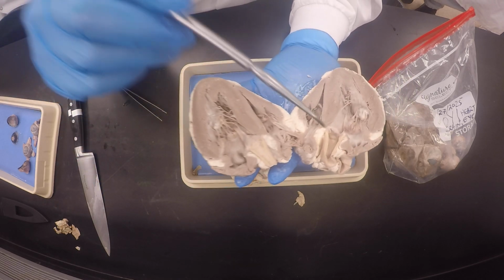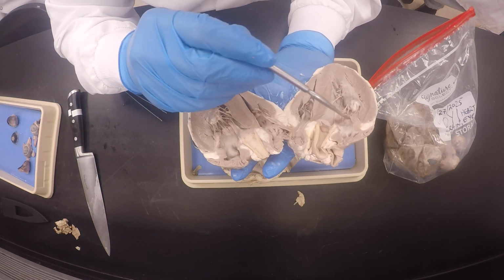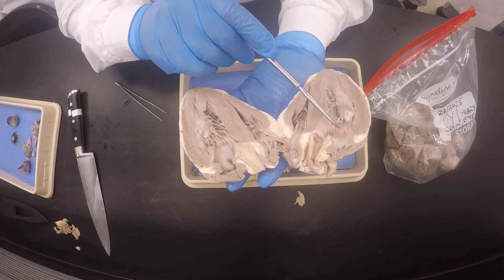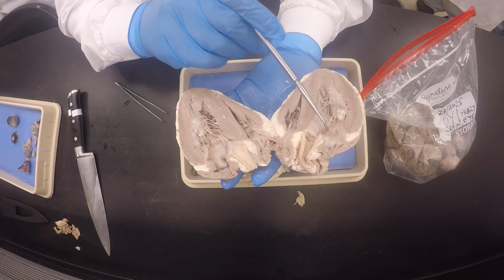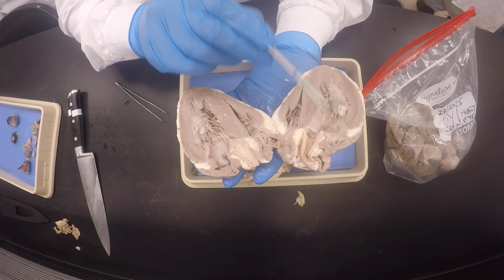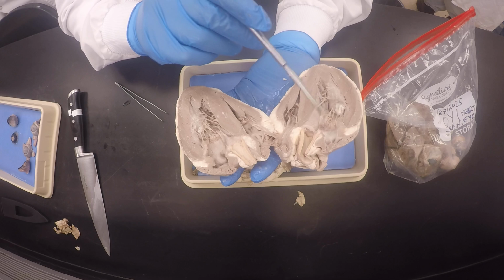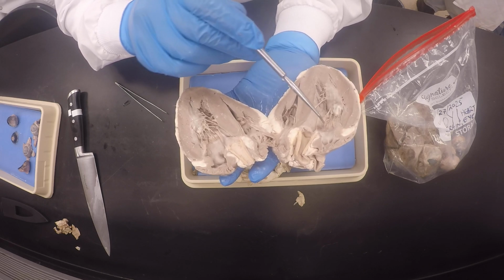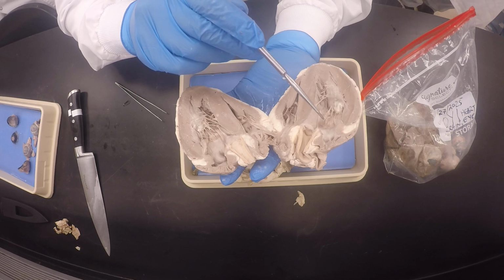So now we're going through the parts. We have just identified this one, right? Okay, which is the bicuspid valve or mitral valve. Is the left atrioventricular valve, but I like you to call it the bicuspid. Why? Because you're going to know how many cusps are in there. See what I'm saying?